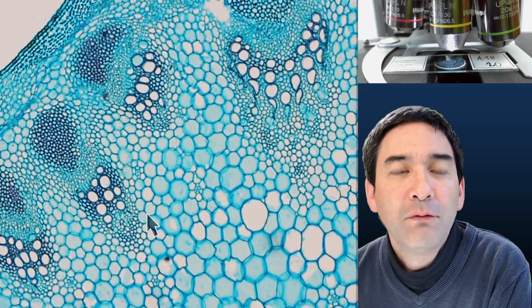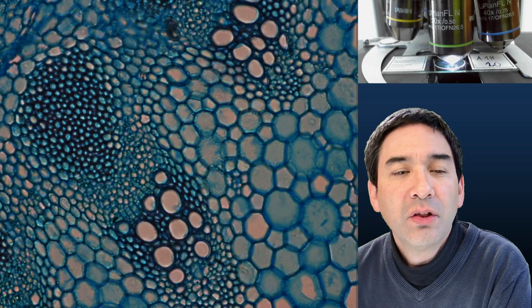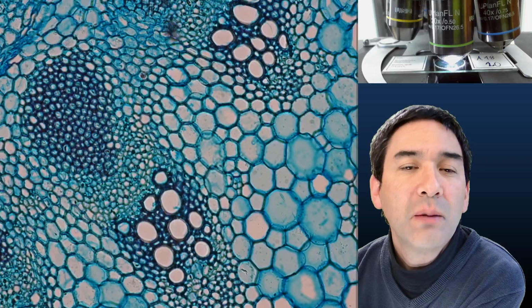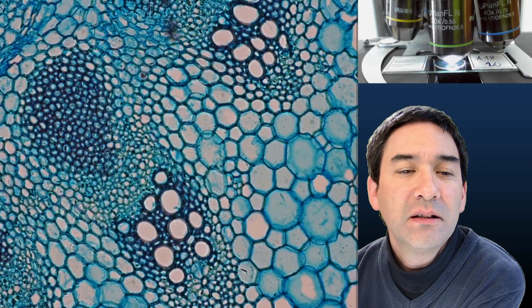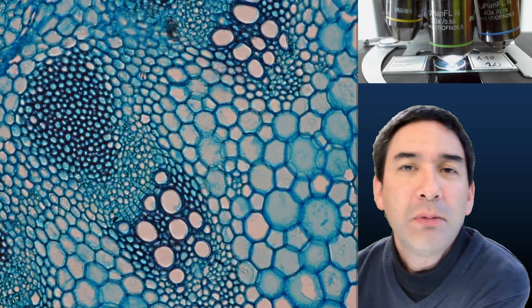and almost as if it has a little bit of volume even, and especially at the higher magnification, you can actually focus through. Let me turn off the arrow again here. You can even focus through the different layers a little bit. You can see that things start to come into focus, and different parts of the cell will move in and out of focus. You have to observe this very carefully to be able to see that.